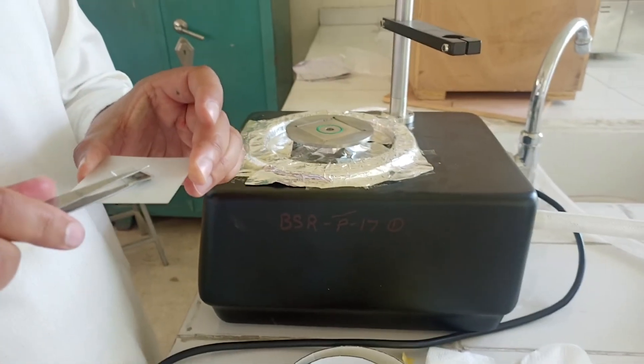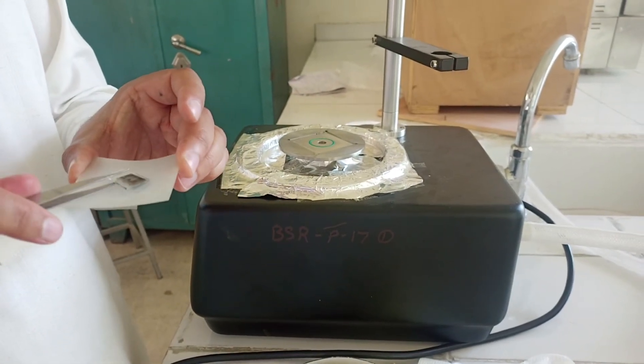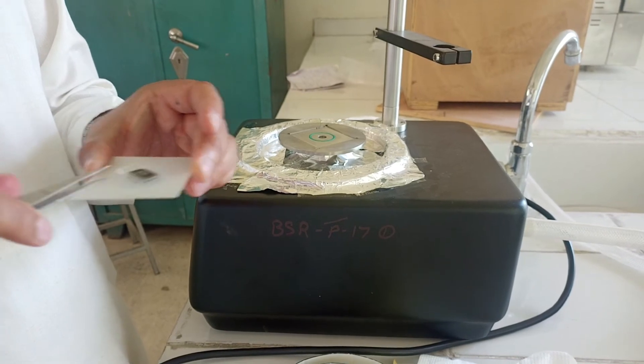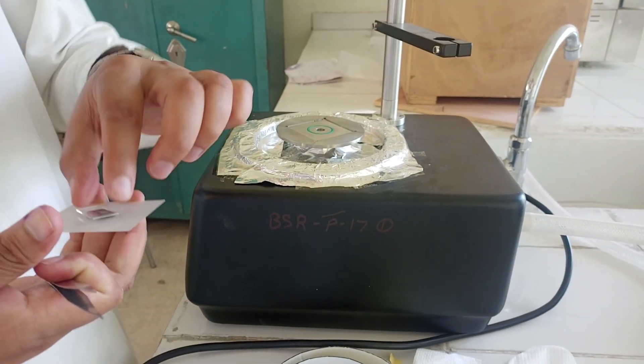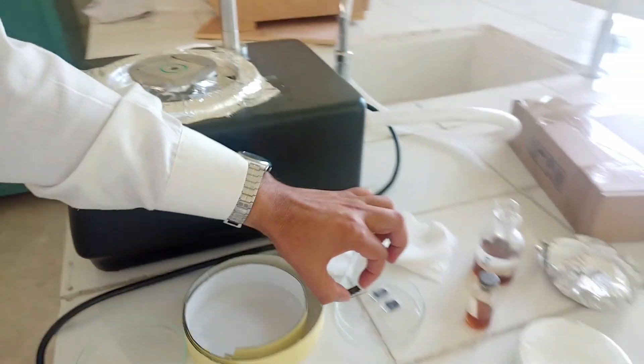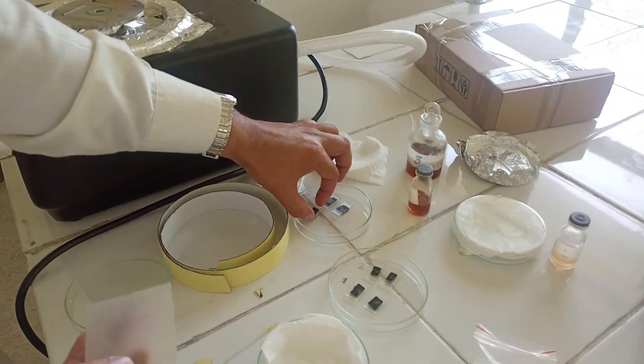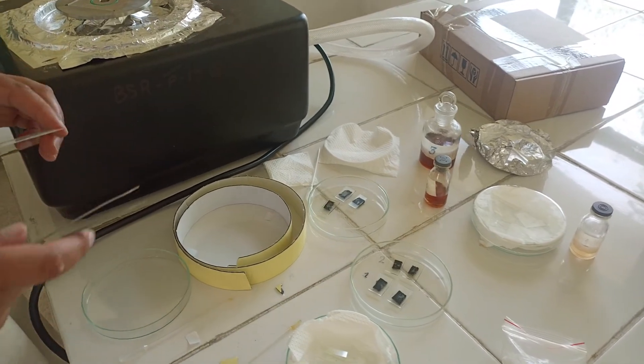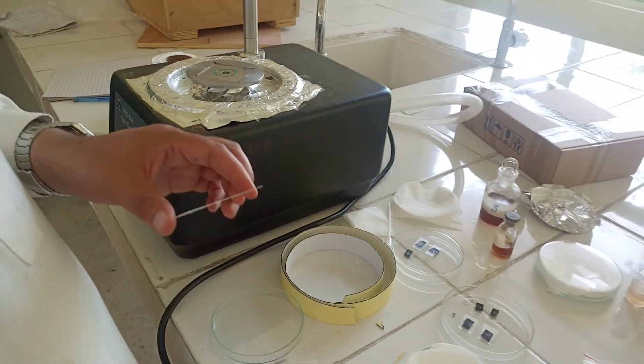From the sides we can hold it, and here we are going to place it. In this way we can deposit thin film.